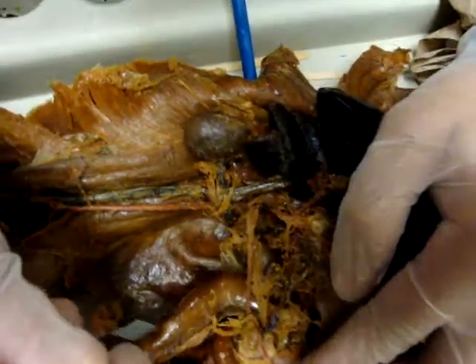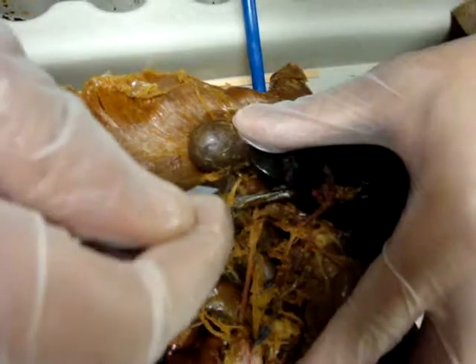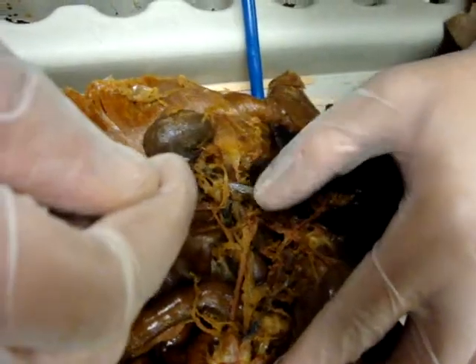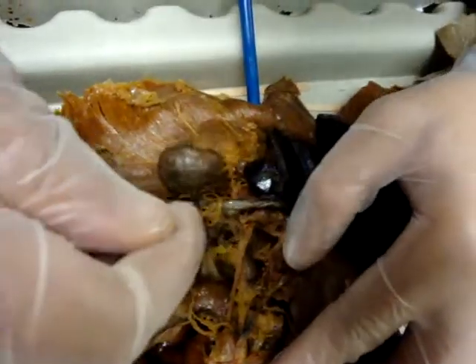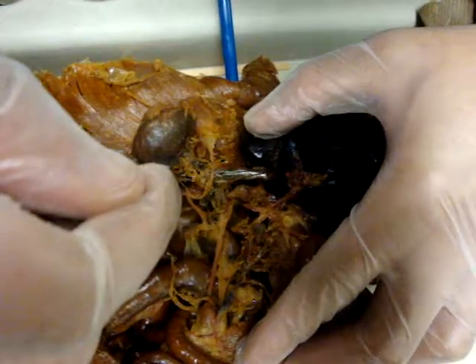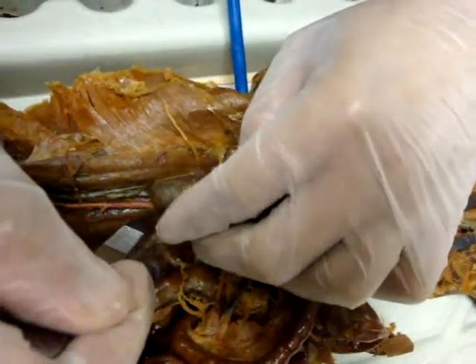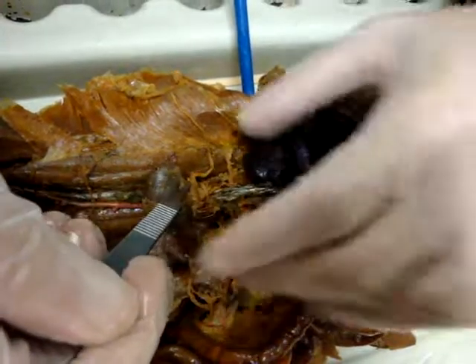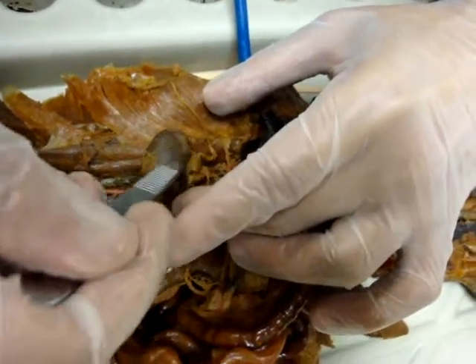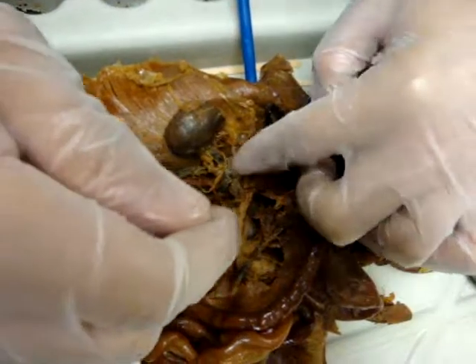The renal vein. Renal vein. Renal artery. Renal artery. Can you see the adrenal gland? Adrenal gland — right here. Looks like fat.